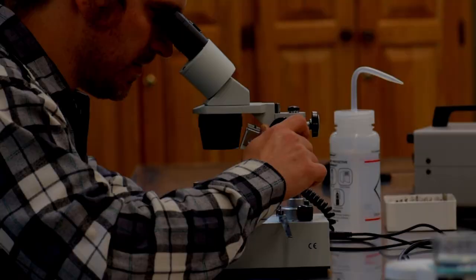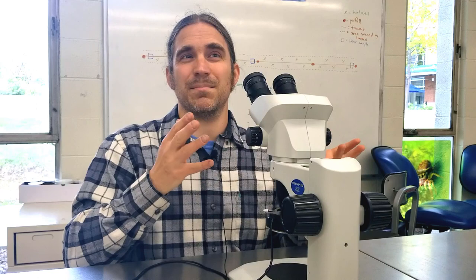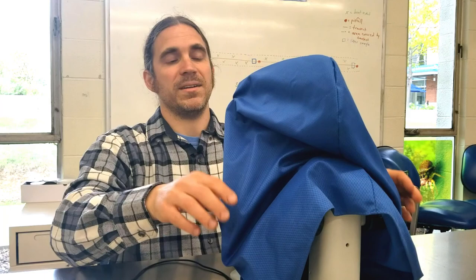Whenever you're done with your microscope at the end of the day, you want to cover it with something to prevent dust from getting in. The more dust gets in, the more you can see it through the eyepieces, making it unpleasant to use. If enough gets in, it can ruin the microscope or cost a few hundred to a few thousand dollars to get it cleaned. Most microscopes will have a dedicated cover; if not, a large enough plastic bag works. Always cover your microscope to keep dust from settling into the internal mechanisms and messing up the optics.